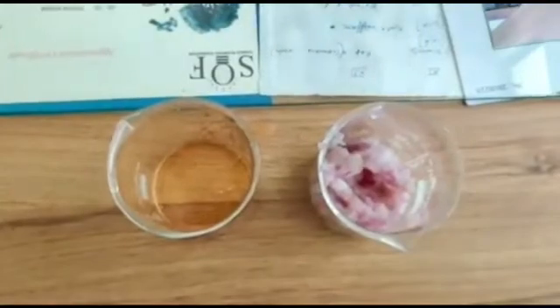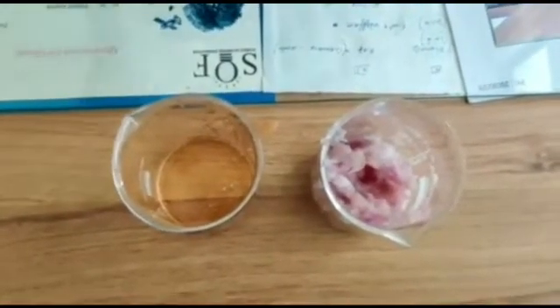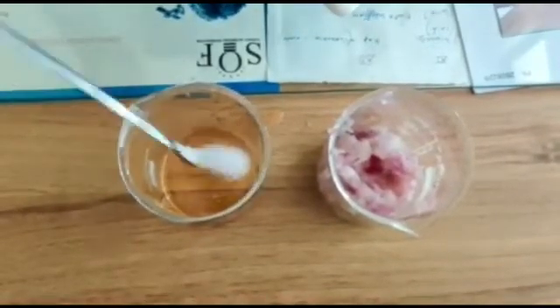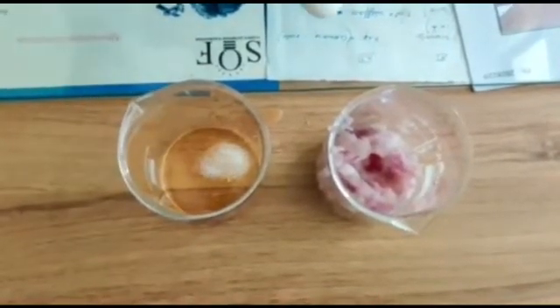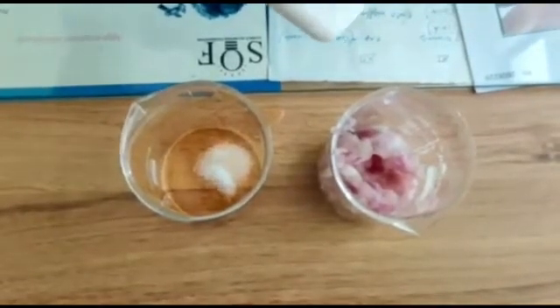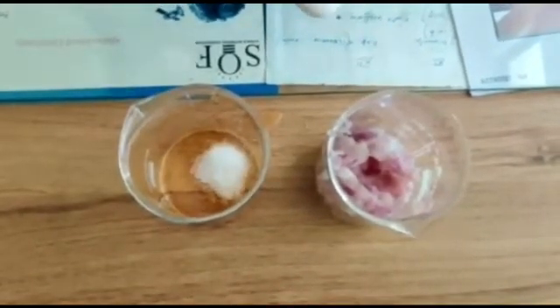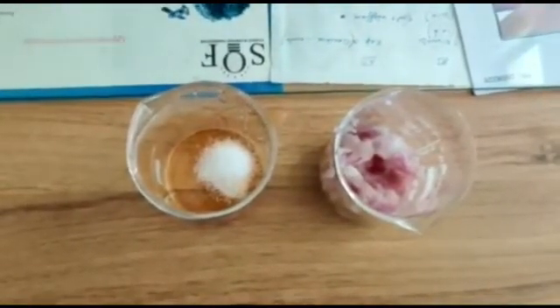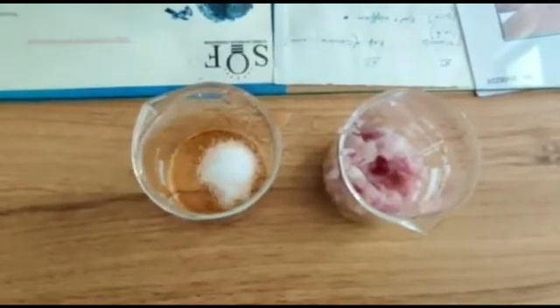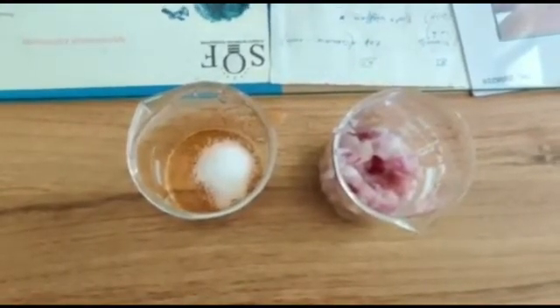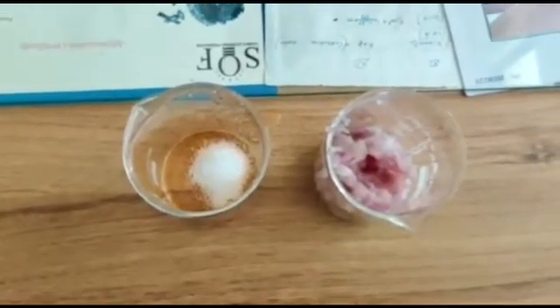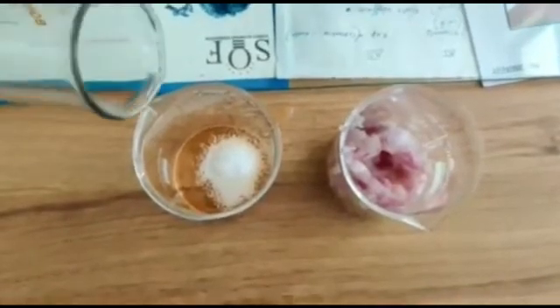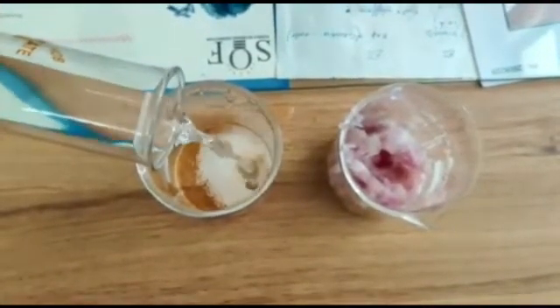This is sodium chloride, just to separate DNA from tissues: one, two, three, four. You may take some extra—it depends on the quantity of onion. Now we add 40 ml of water.